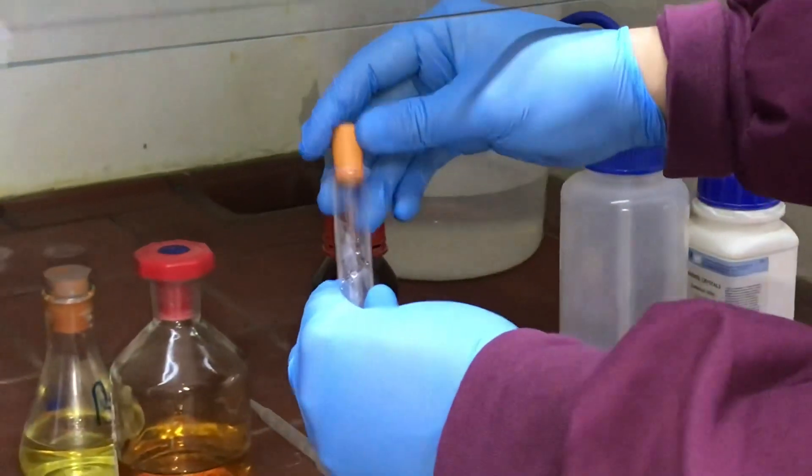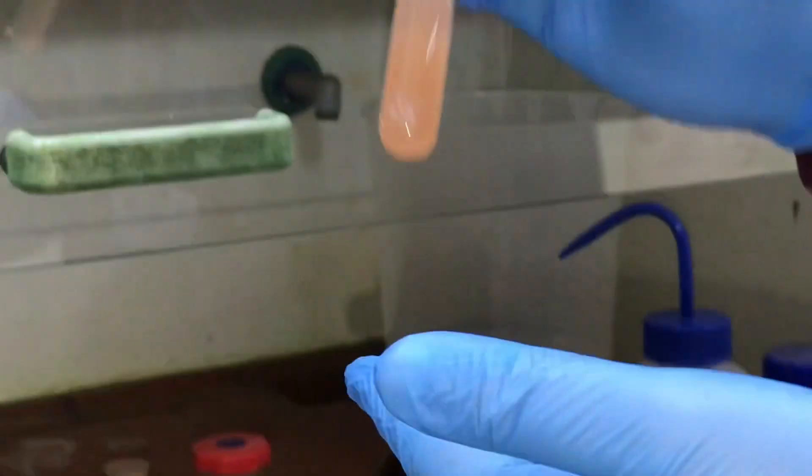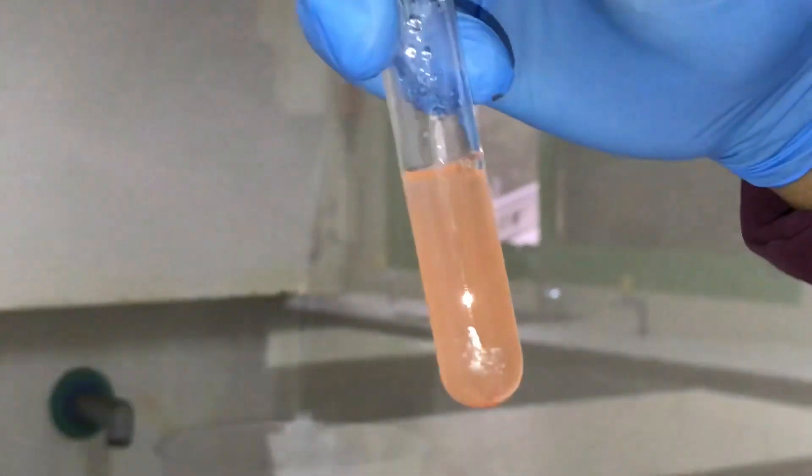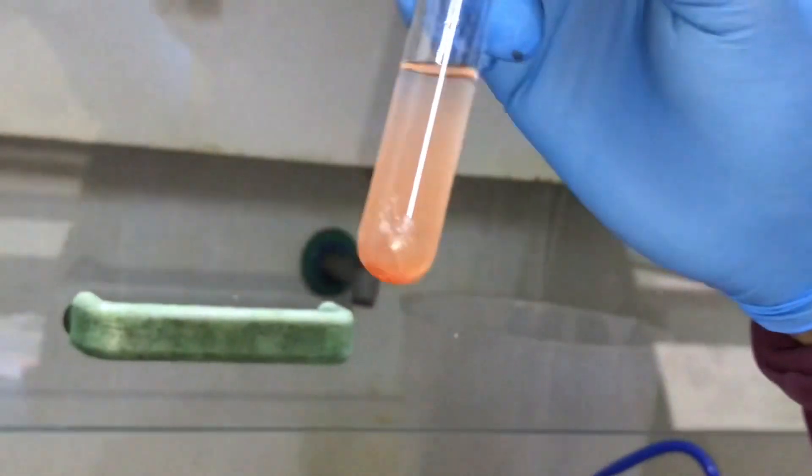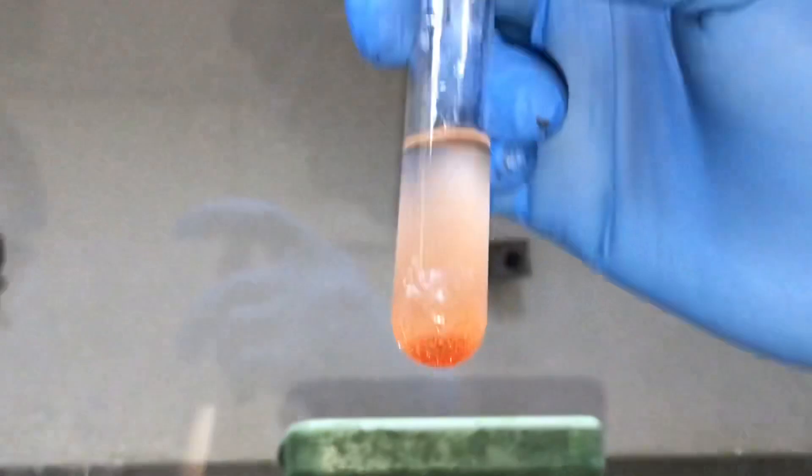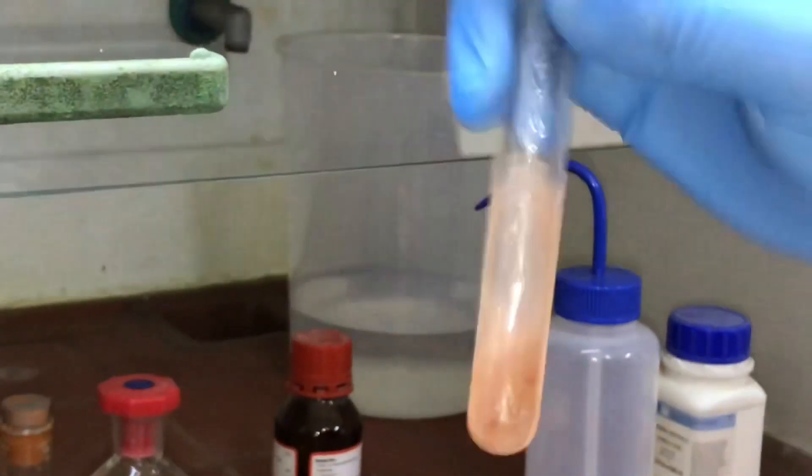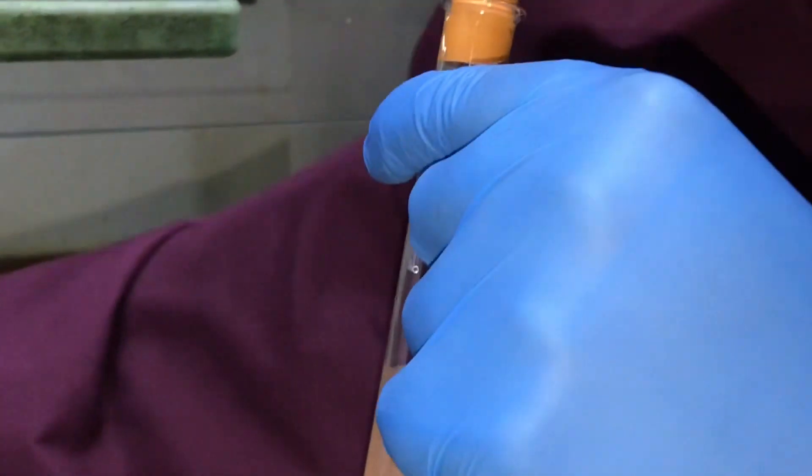When doing organic reactions, sometimes it's worth releasing the pressure because you get vapors coming through. You can see it's gone cloudy—the phenol's decolorizing the orange bromine solution. There should be a white precipitate starting to form. It takes a little while to settle, so here's one I did earlier.